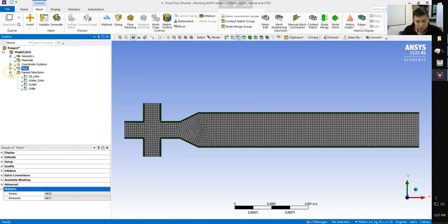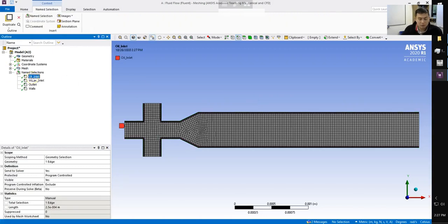Okay. So we can see our set of name selections. So we have our inlet for oil. Top and bottom will be our water inlet, our oil outlet, and then our 12 walls. Okay, with that we can go ahead and save. And that concludes our geometry and meshing for the microfluidics channel.